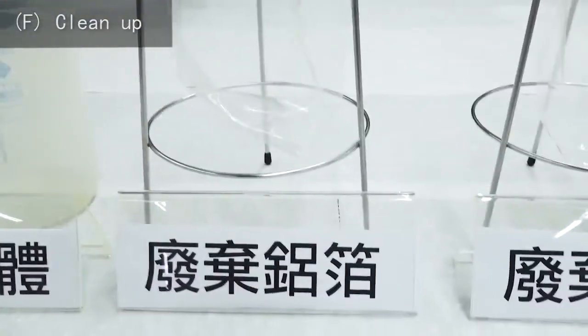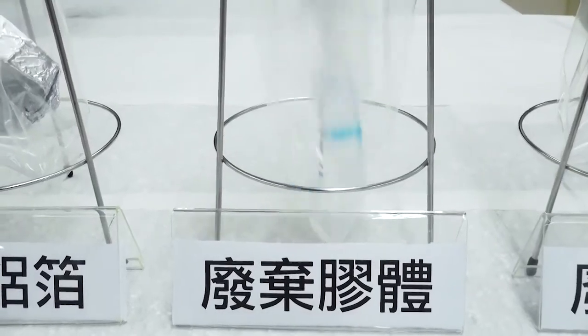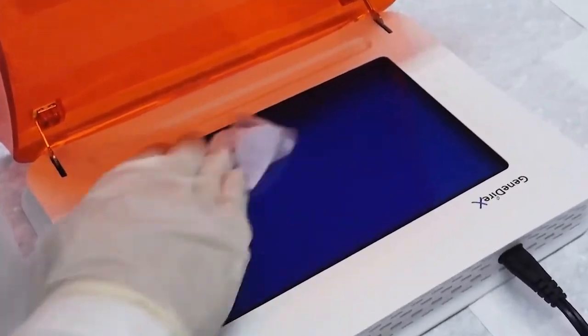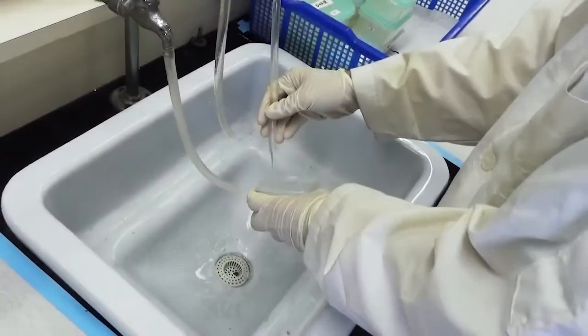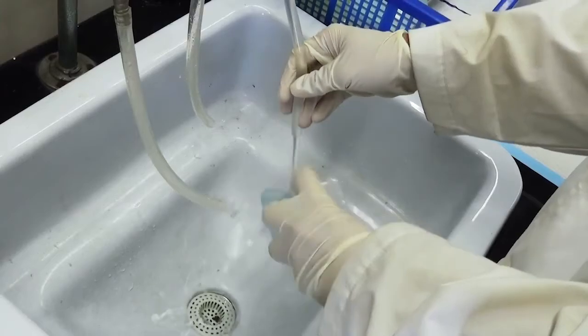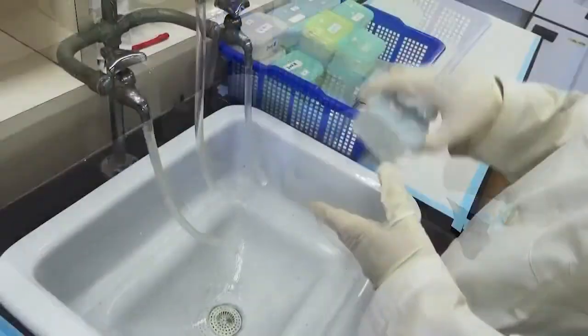Dispose of the staining liquid waste, solid waste, and other waste into separately labeled containers. Use a Kimwipe to remove any remaining liquid on the imaging systems. Any containers contaminated with staining dyes must be cleaned in a designated sink, dried with paper towels, and put back into storage.